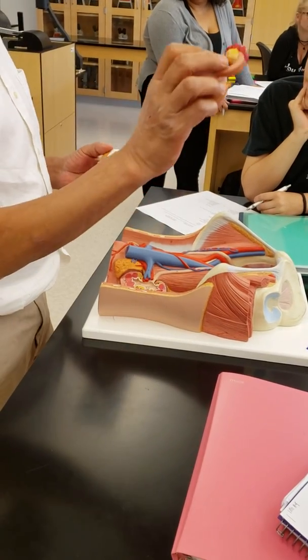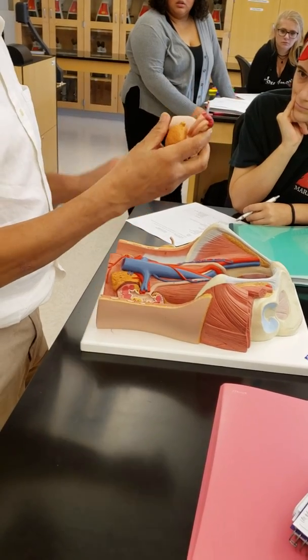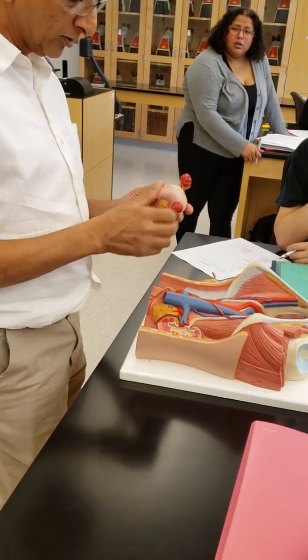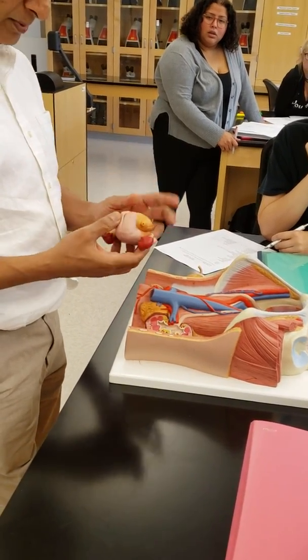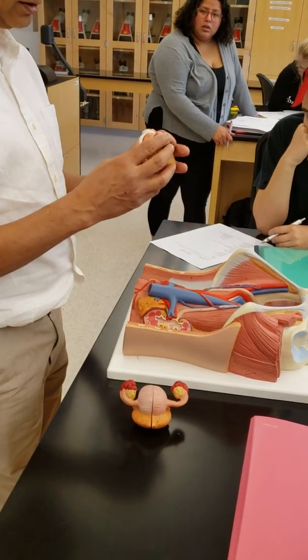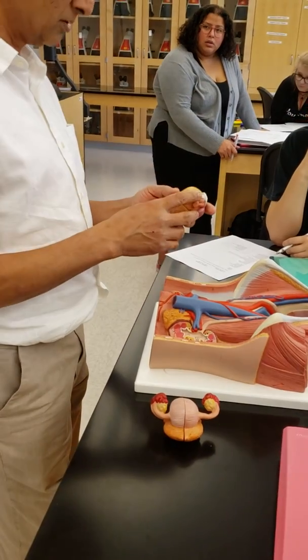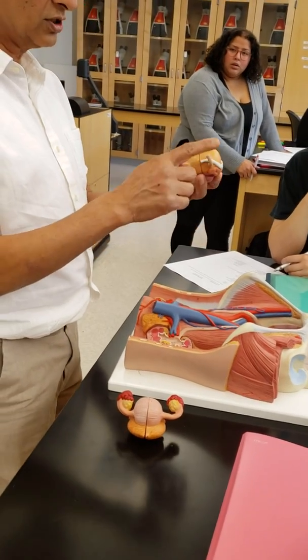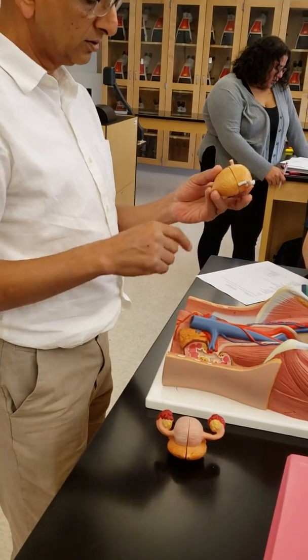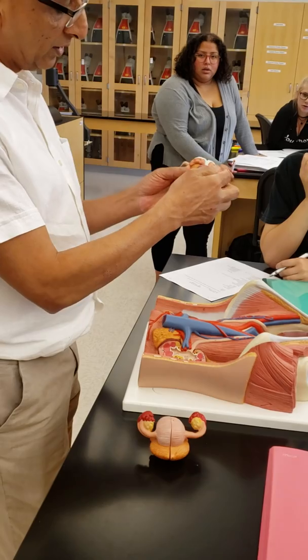This is a female with the two ovaries here, right? Over here. And in the female, you also have the uterus and the bladder. And in the male, you have the prostate and other structure that I will tell you in that system. So what are these two things here? Ureter.